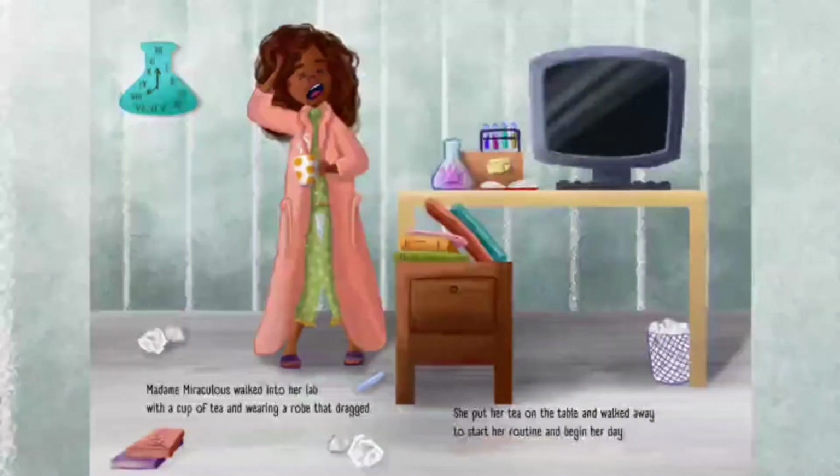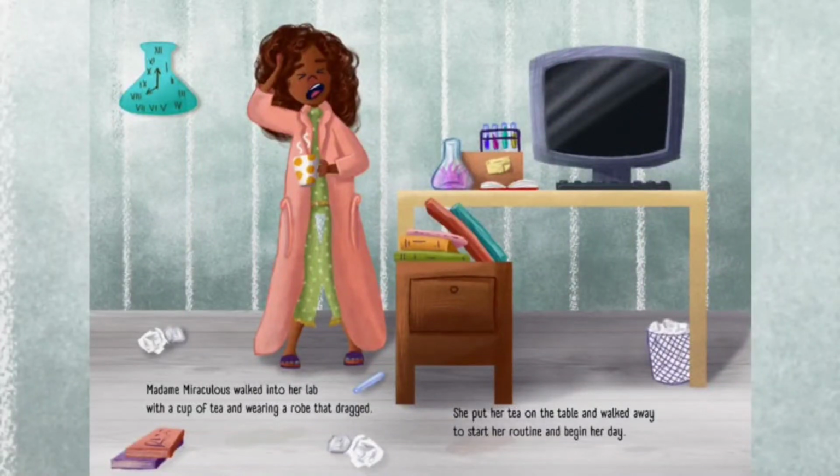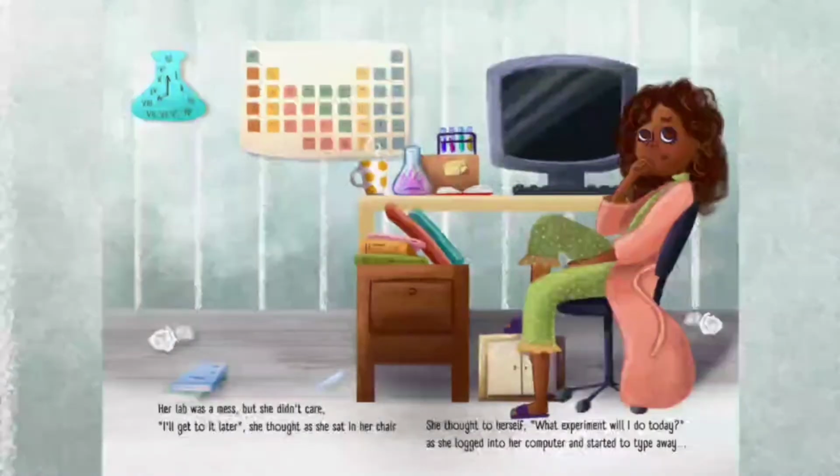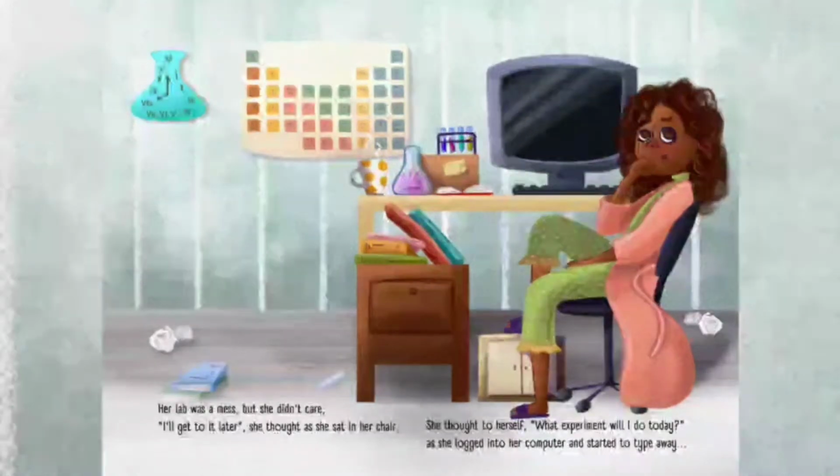Madame Miraculous walked into the lab with a cup of tea and wearing a robe that dragged. She put her tea on the table and walked away to start her routine and begin her day. Her lab was a mess, but she didn't care. "I'll get to it later," she thought as she sat in her chair. She thought to herself, "What experiment will I do today?" as she logged into her computer and started to type away.